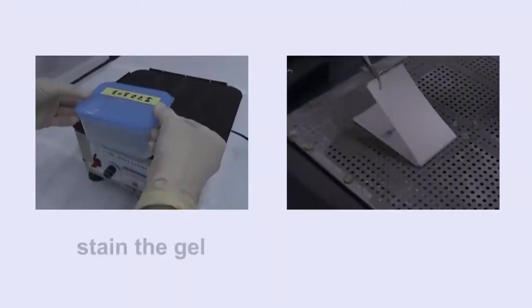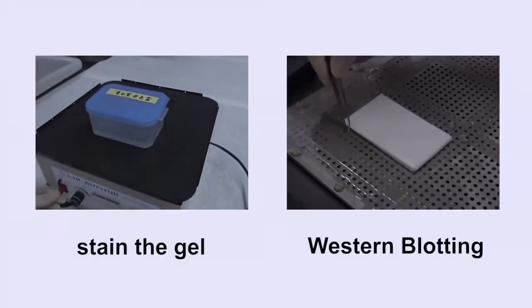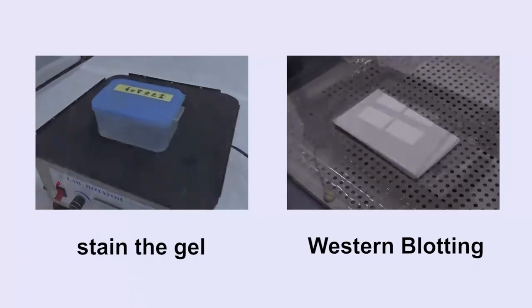Next, we may stain the gel or carry out western blotting. Please continue watching the demonstration videos for these lab techniques.